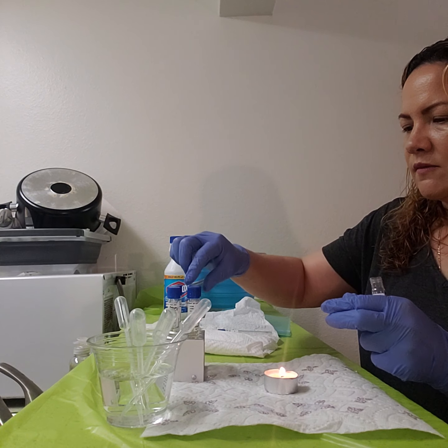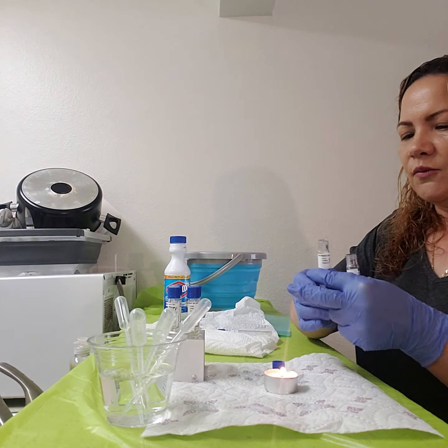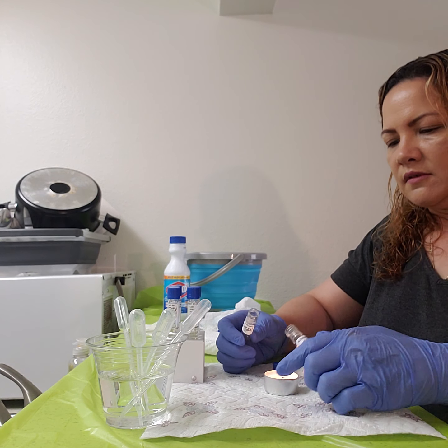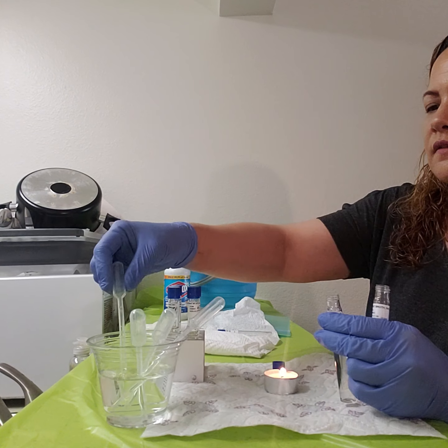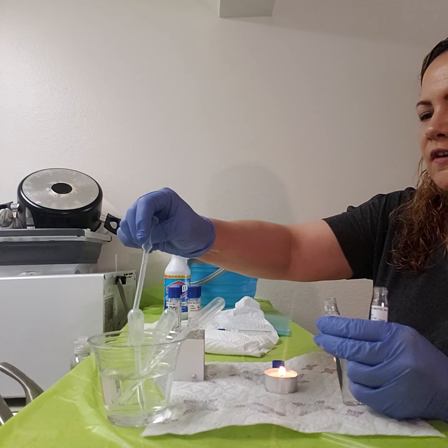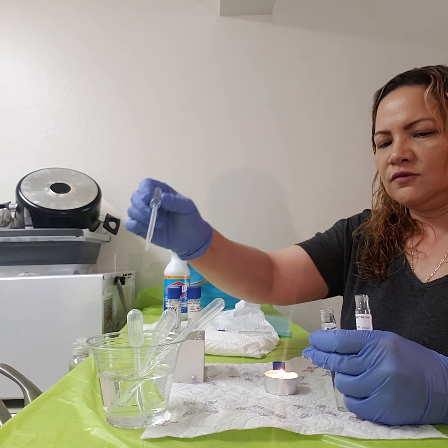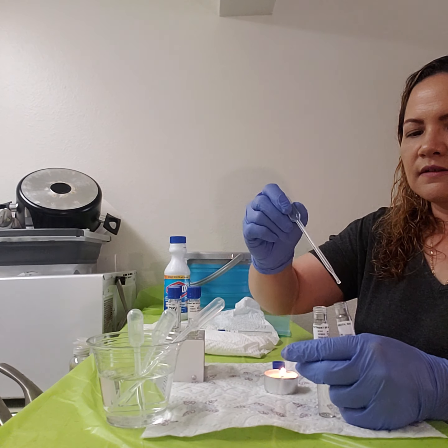Okay, these ones are much easier to stand up because they're not so hard. I think the other ones were more of a glass. These are more of a plastic. So I'm going to do the same thing, sterilizing the tip. Okay, doing the same thing. You get familiar after doing this so many times. And again, I'm only going to take 2 drops from the broth of the epidermidis.